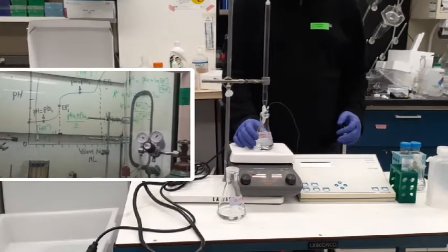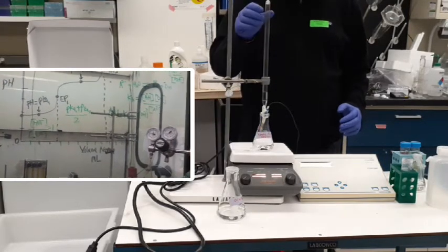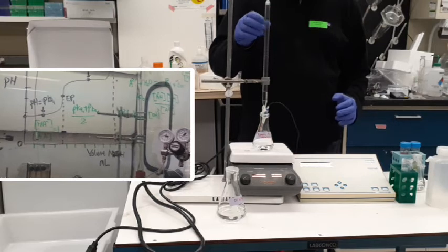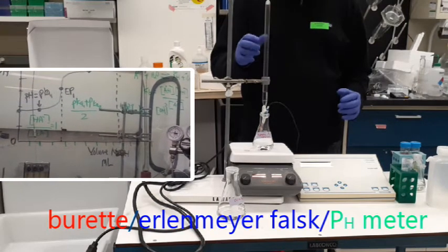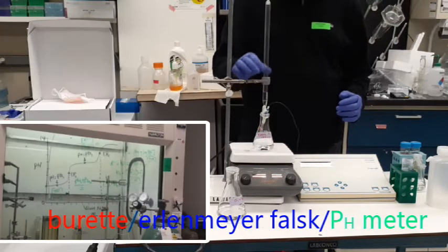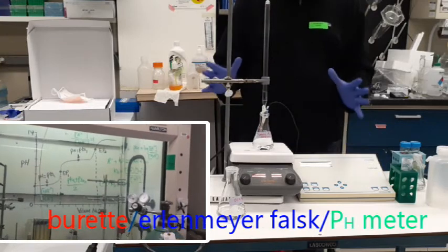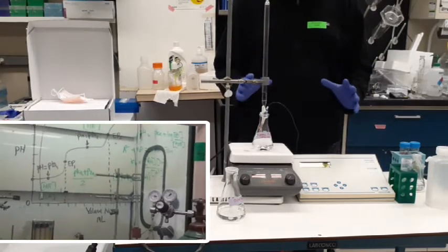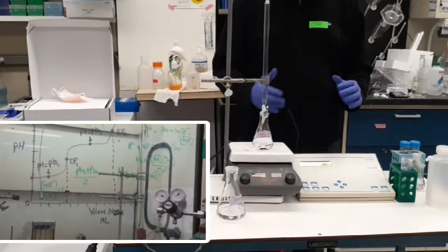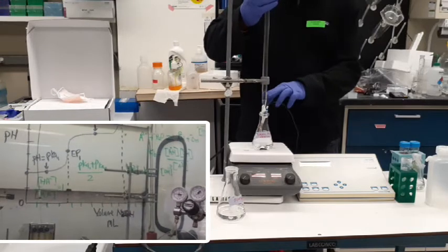Hi everyone, here is a setup for today's experiment. Today's experiment involves titration. Titration is a simple chemical analysis where you need a burette, an Erlenmeyer flask, and also a pH meter. In this experiment, we are going to titrate a triprotic acid against a 0.1 molar sodium hydroxide.